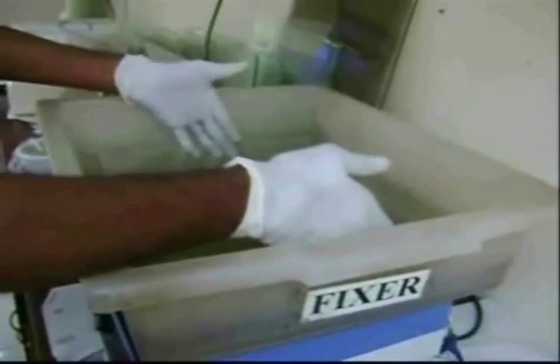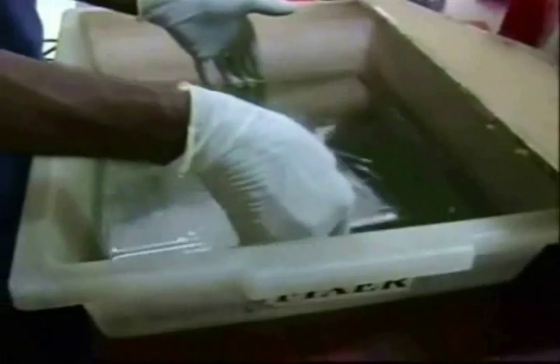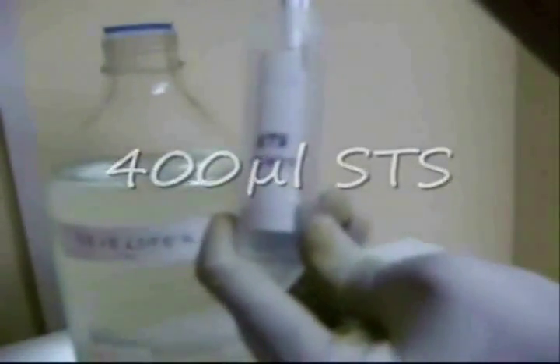The glass plate is immersed into the fixer solution. It is then allowed to shake in the shaker for about 15 minutes. The plate is removed from the fixer solution and given a distilled water wash. After the wash, the plate is subjected to staining solution for about 15 to 20 minutes. The staining solution contains silver nitrate and formaldehyde. Silver ions are photosensitive, so the tub is covered.